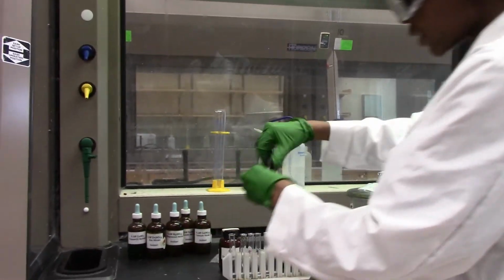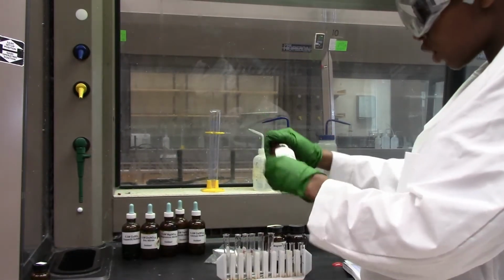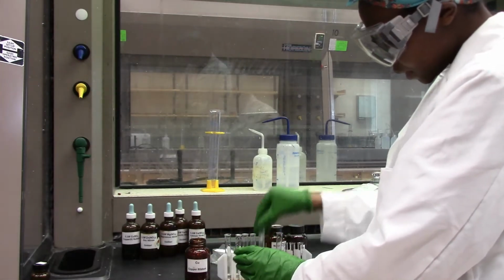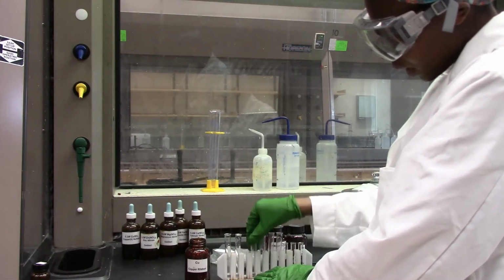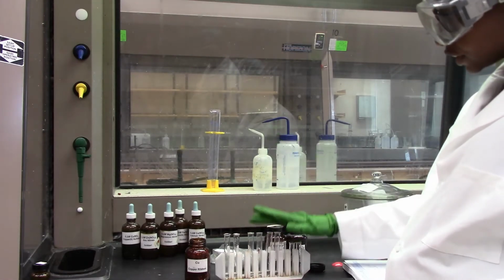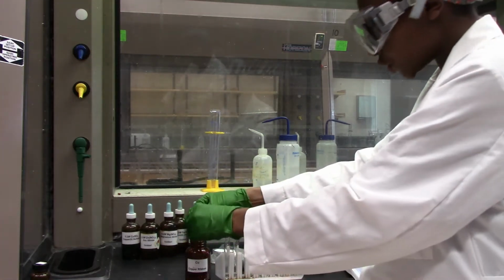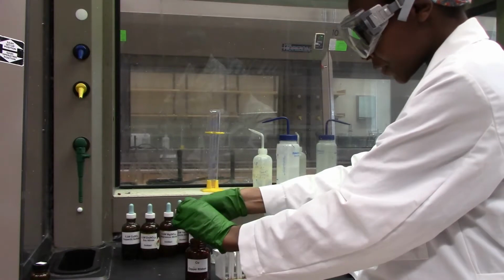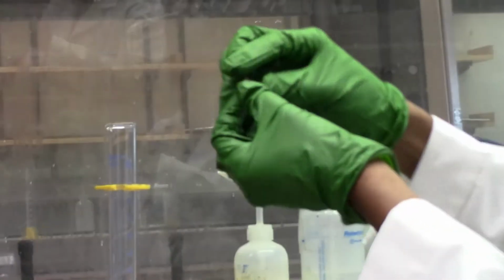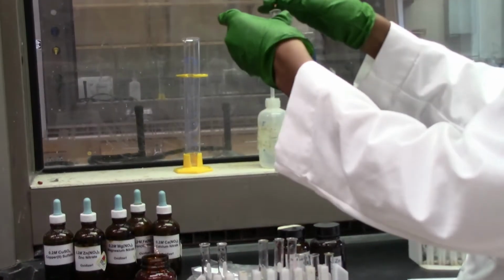Now that we're done with our solid calcium, we are going to do copper next. The rest of the metals, I'll just be putting them in HCl solution. So this is copper, and I will take a tiny piece of copper metal and drop it in HCl. Alright, let's see what happens.